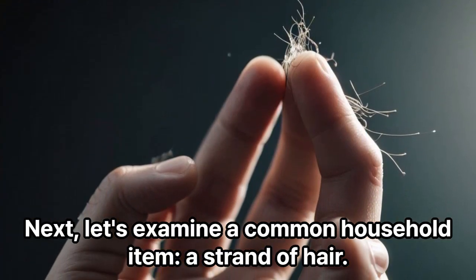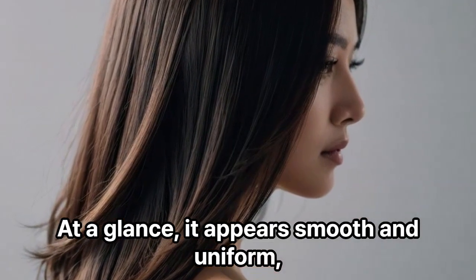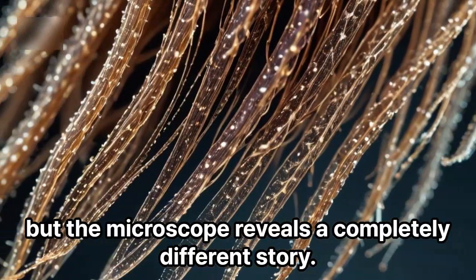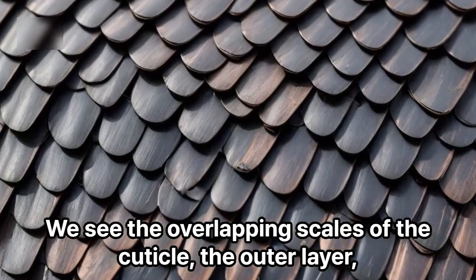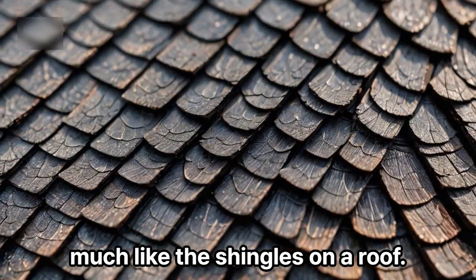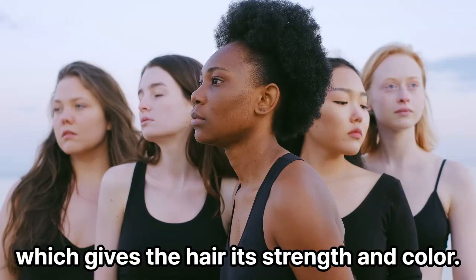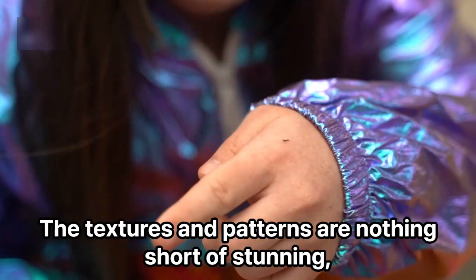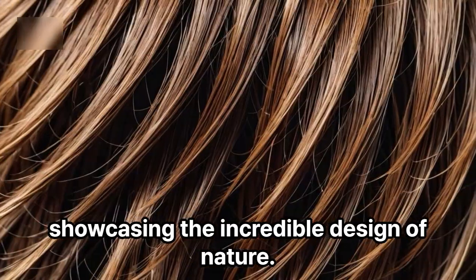Next, let's examine a common household item, a strand of hair. At a glance, it appears smooth and uniform, but the microscope reveals a completely different story. We see the overlapping scales of the cuticle, the outer layer, much like the shingles on a roof. These scales protect the inner cortex, which gives the hair its strength and color. The textures and patterns are nothing short of stunning, showcasing the incredible design of nature.